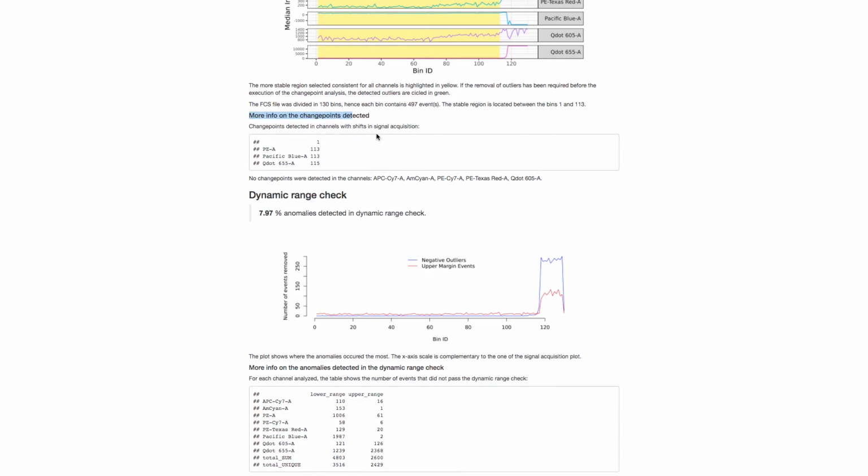For more information on change point analysis, you can look at the written documentation, and this is organized by rows and columns. Right now you can see that based on our settings, only 1 change point was detected. But if more had been detected, and that's also based on the data and our settings, they would be listed here as columns. The last method to turn our attention to is the dynamic range check.